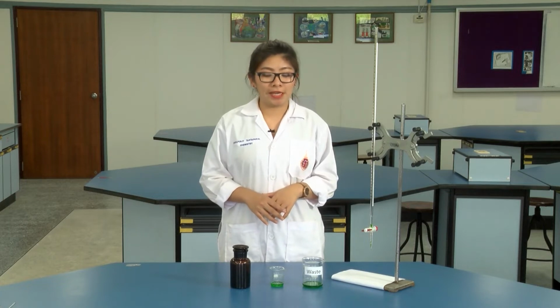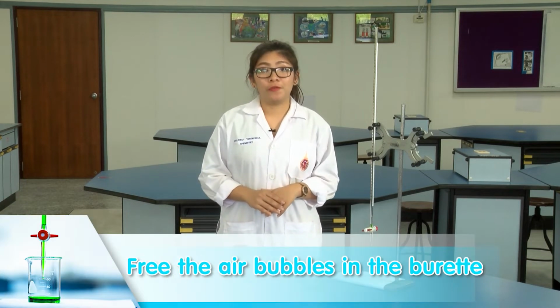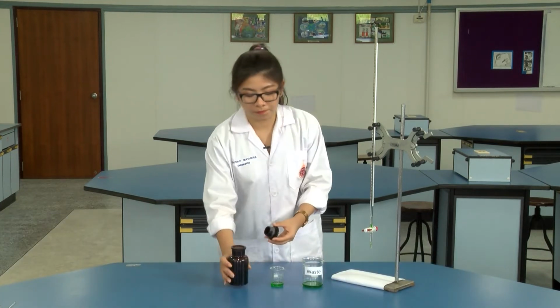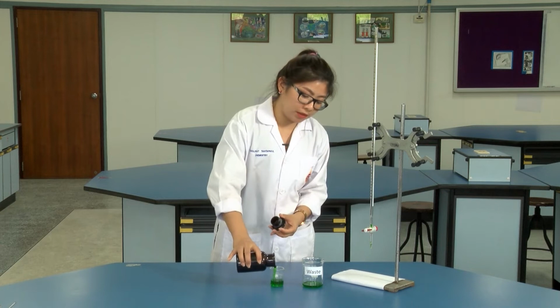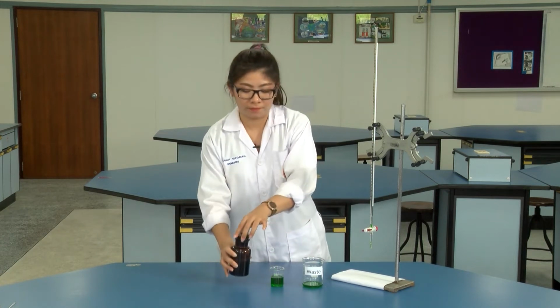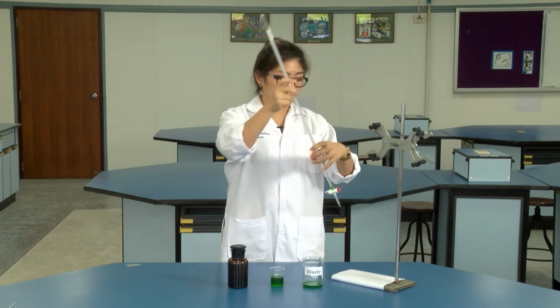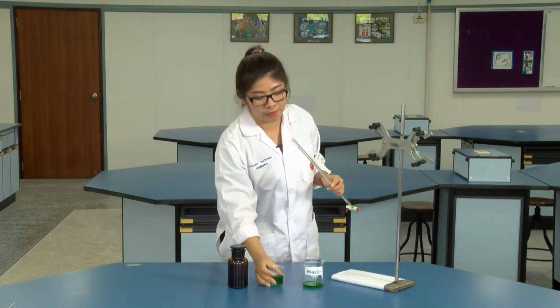After you have rinsed the burette, we're going to free the air bubbles in the burette. First of all, transfer your standard solution and fill the standard solution in the burette.